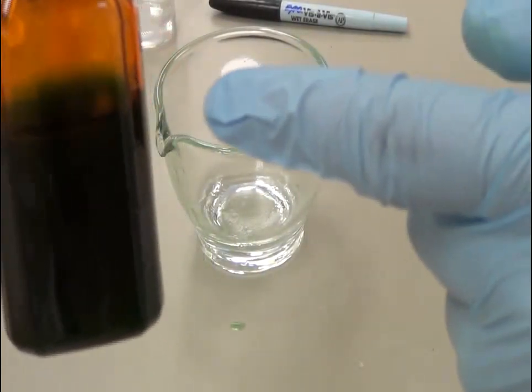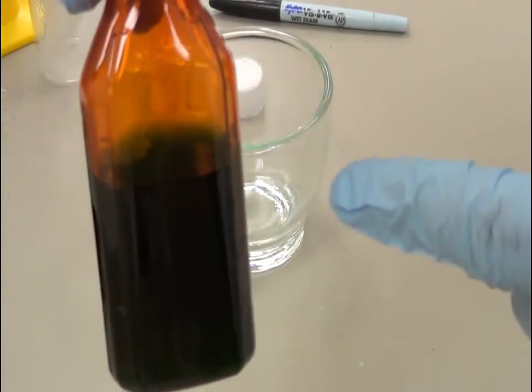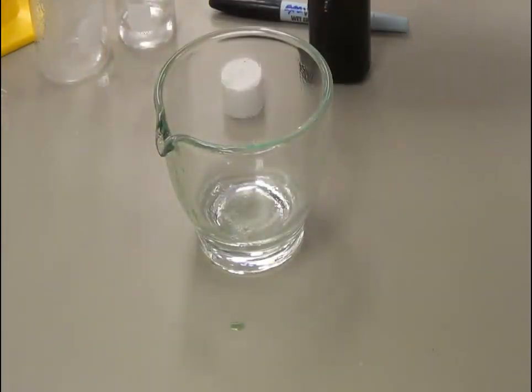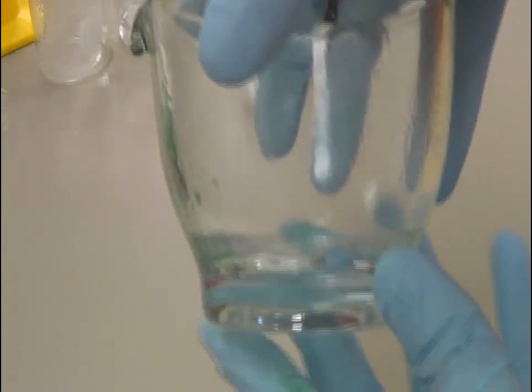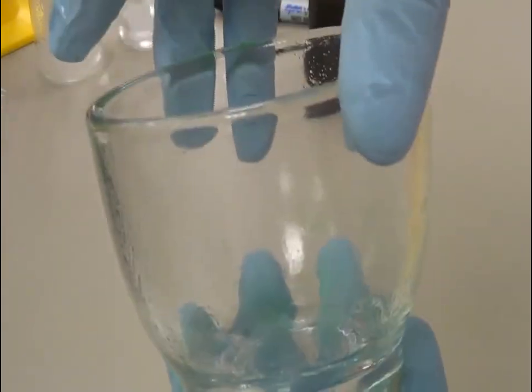Pouring back into the bottle — as you can see, we have reached exactly the calibration mark. This is 30 ml, as shown by the calibrated mark. As you can see, I don't have any drug left over.